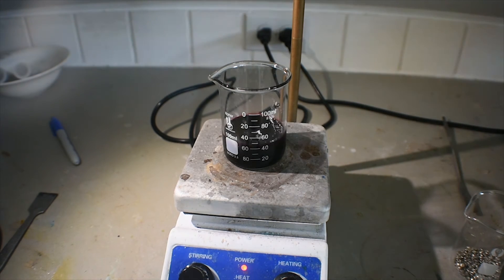Once I'm done with that, I'm going to put the hot water in the dish, turn on stirring, and set the beaker in the hot water. Then I'm going to add the tin and the reaction should start. It shouldn't be violent at all — this is a pretty calm reaction from what I've seen. I did it yesterday and it was absolutely fine with this temperature of water.